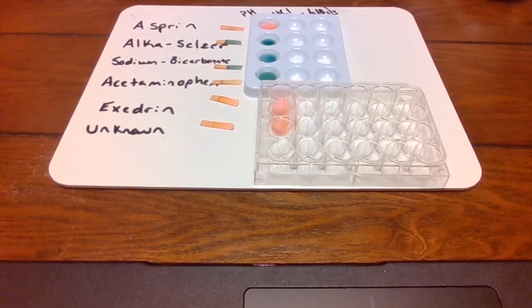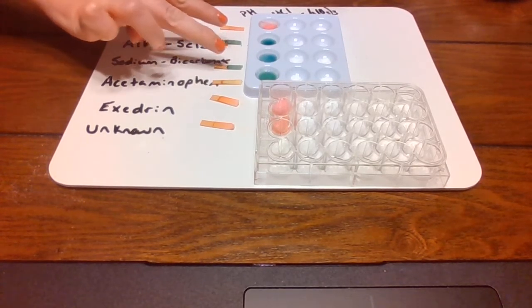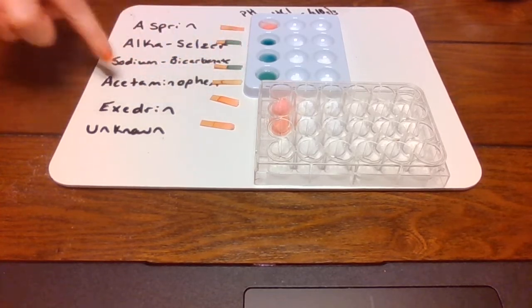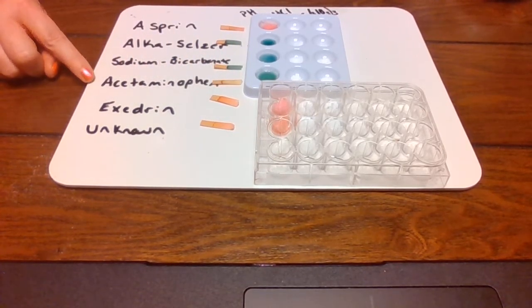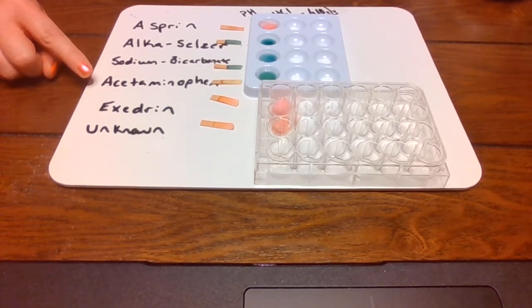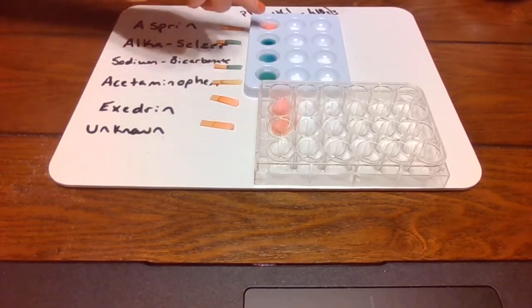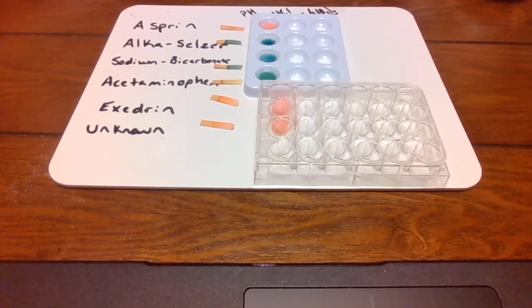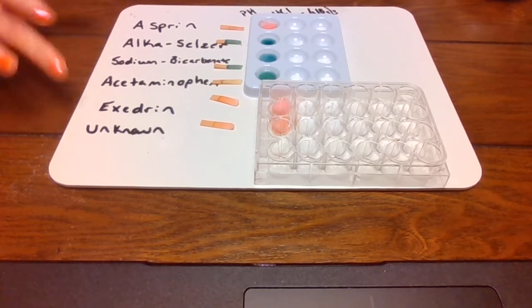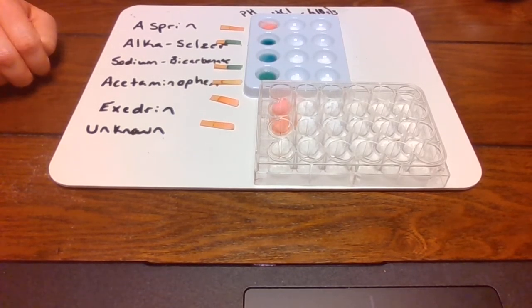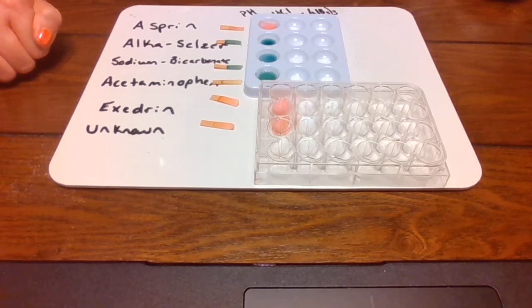So basically these two are most blue and this is more of a green, acetaminophen. So acetaminophen is the kind of drug you would take for a headache, pain reliever, fever reducer, but it is not as acidic as our other pain relievers and fever reducers. So if you have tummy issues and you have a headache, then you probably don't want to take aspirin or Excedrin because they are very acidic. So just kind of trivia there.